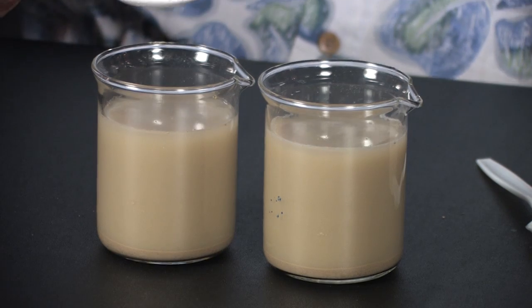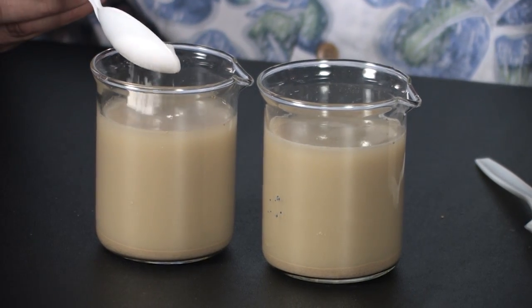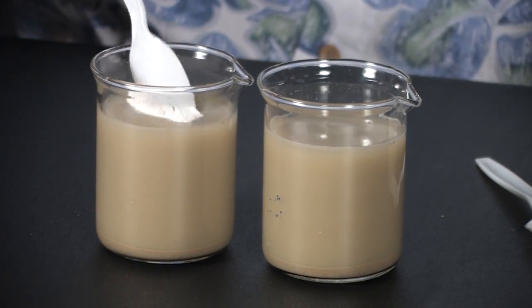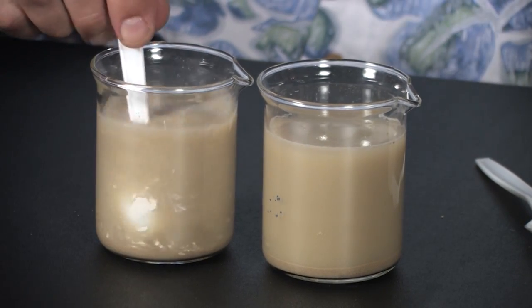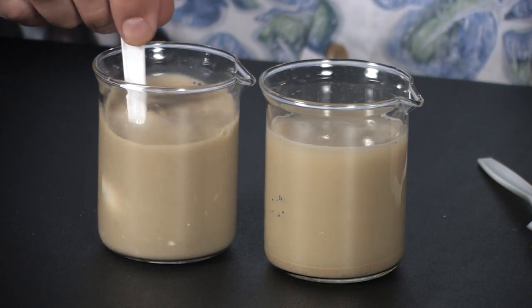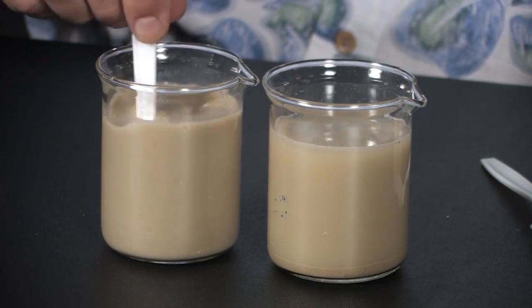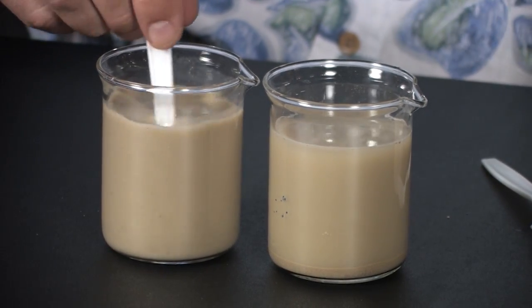Now they'll be big enough that they'll act more like sand particles and they'll settle out. Here I'm putting half a teaspoon of gypsum in, stirring it up, and then we'll watch this over the next half hour.